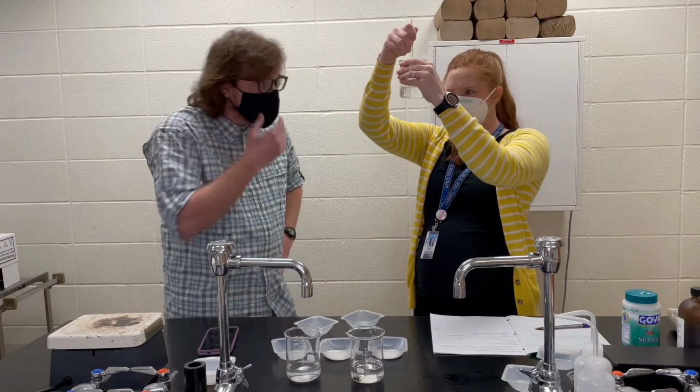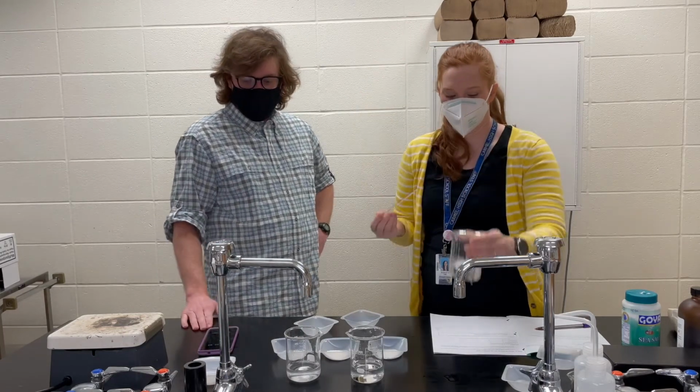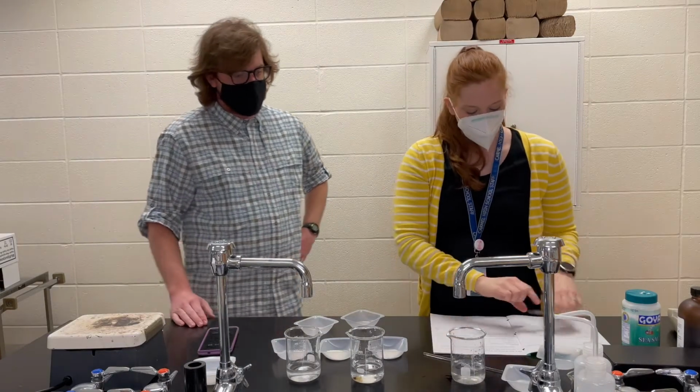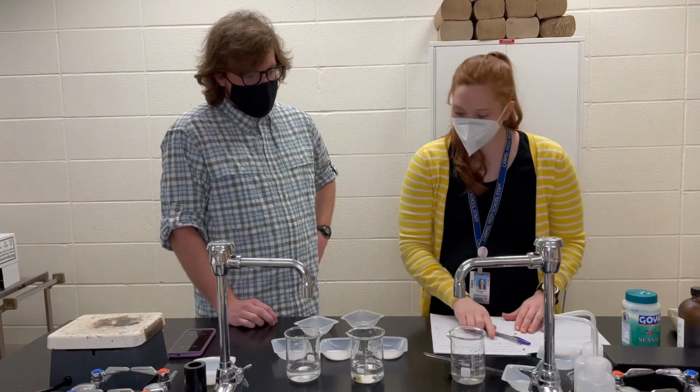Do you see any more? I do not see it. I do not. That's it. That's probably it. All right, that was 22.93 seconds. All right, 22.93. Record that data.